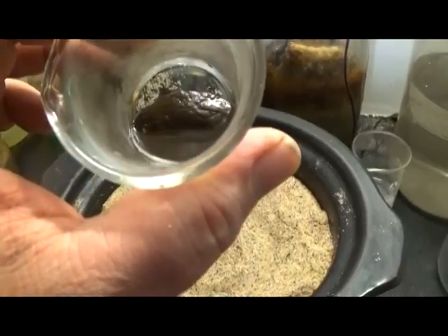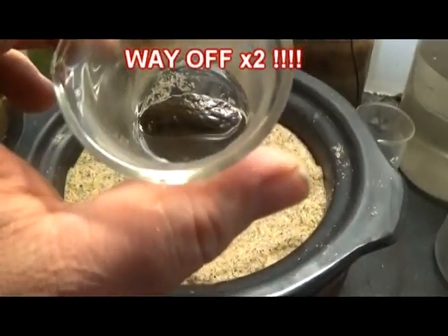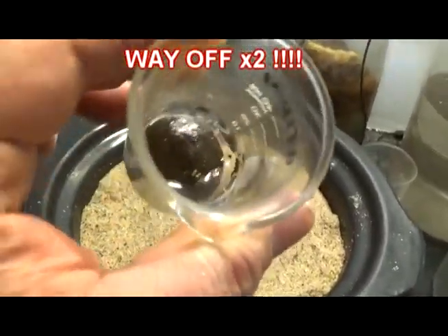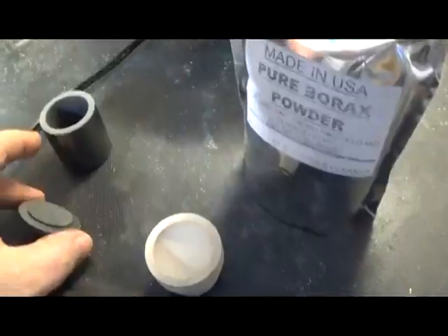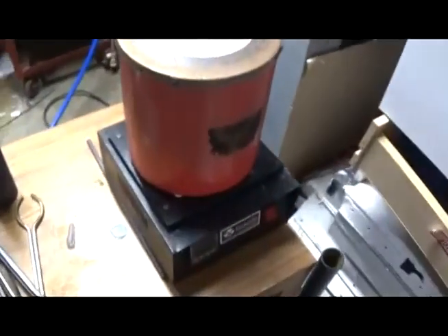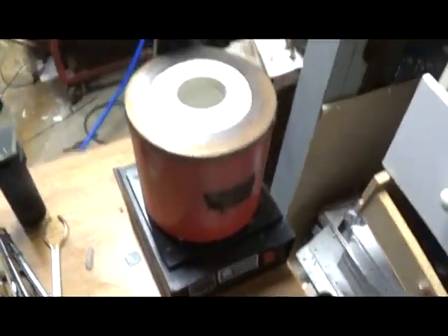I'm betting that's 1.5 grams of 24 karat gold. Good heavy sponge. Good heavy gold. To get it real good and bone dry before it goes in here. And then we're gonna turn the ye olde furnace on.